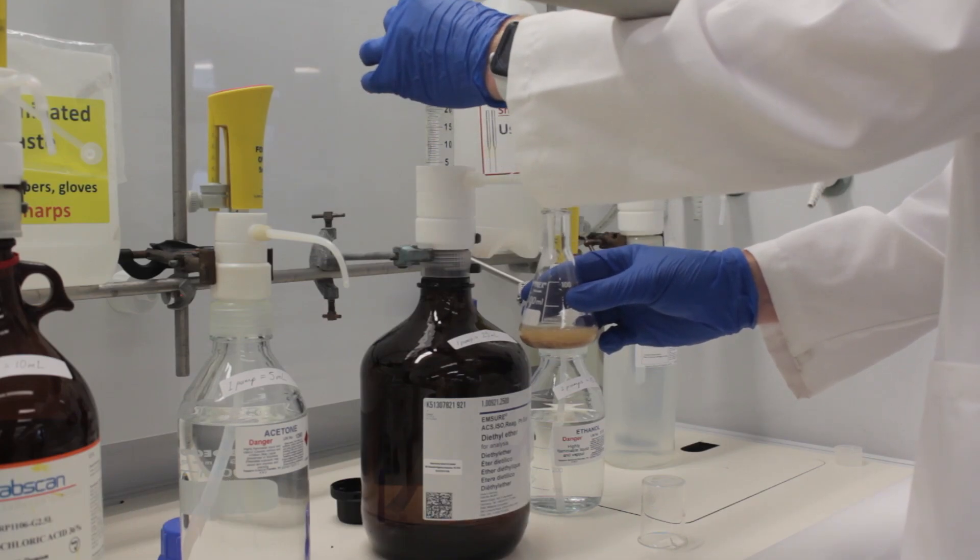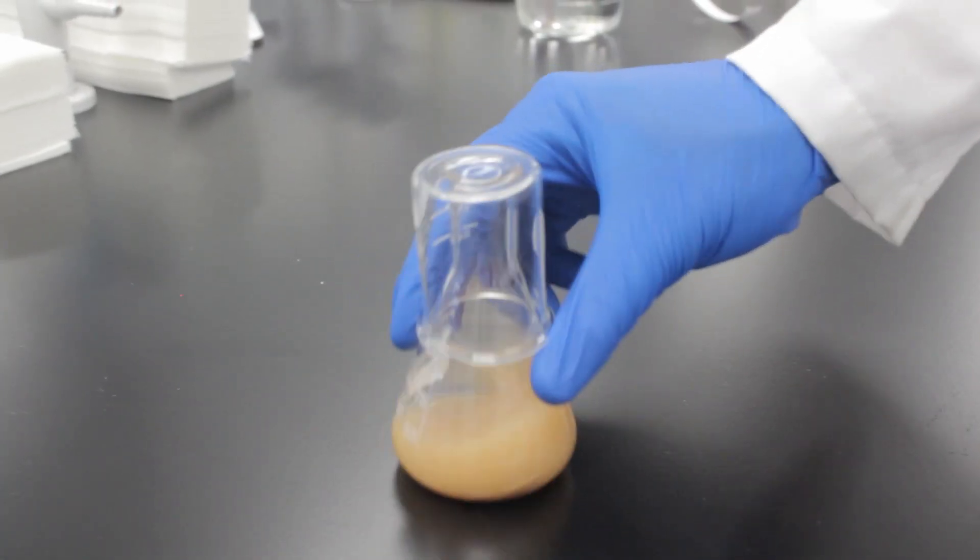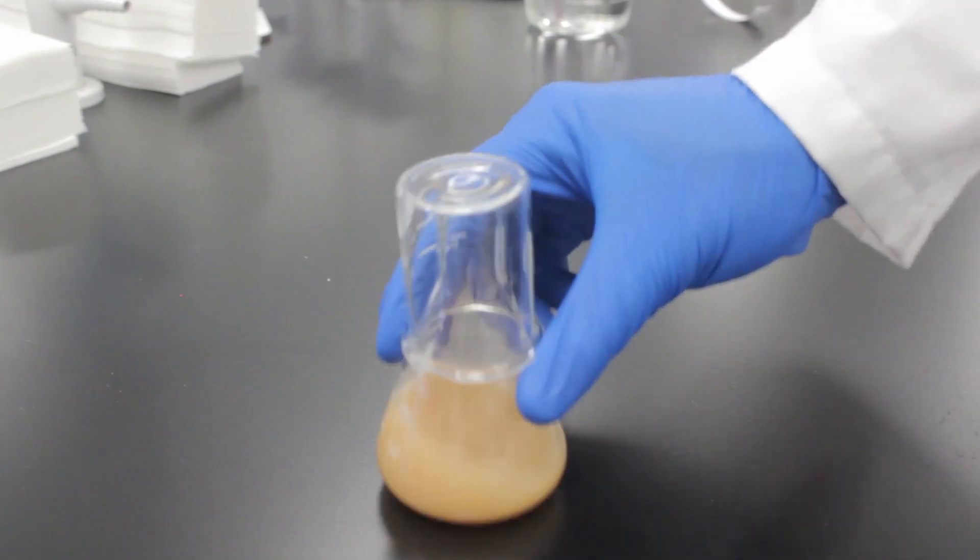Take it back to your bench and swirl for 10 minutes. Ether is quite toxic so cover the top with a beaker to control the fumes.